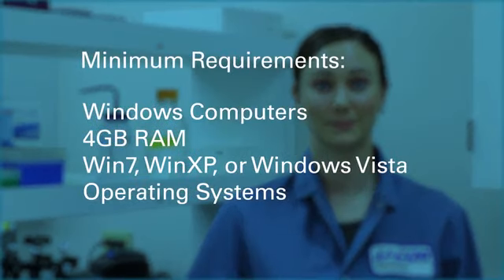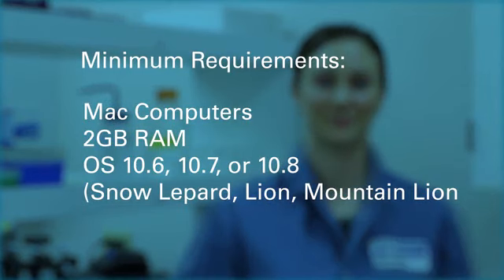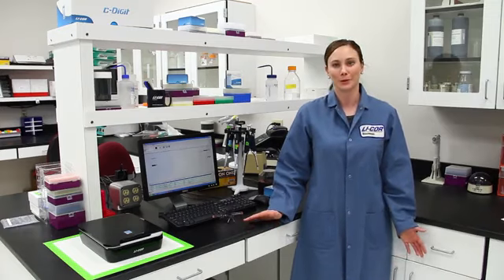And here are the minimum computer requirements for Image Studio. Let me offer some quick tips for successful scanning on the C-Digit so that you get high quality, high sensitivity images right from the start. If you're already doing film, then many of these tips will already be familiar to you.